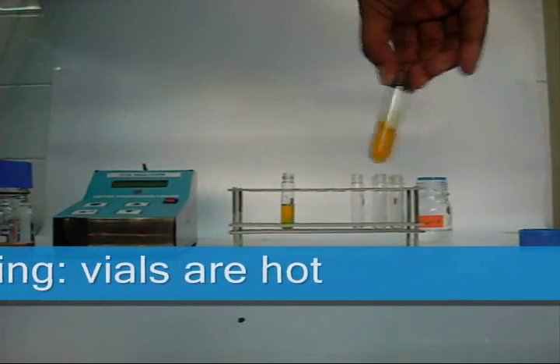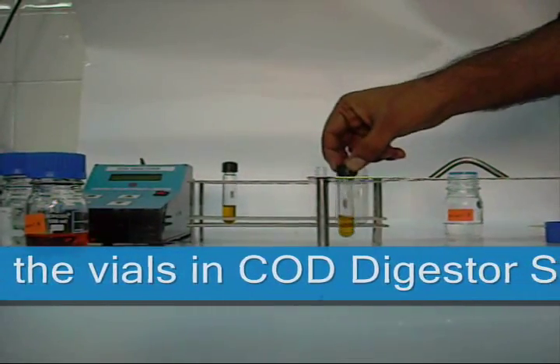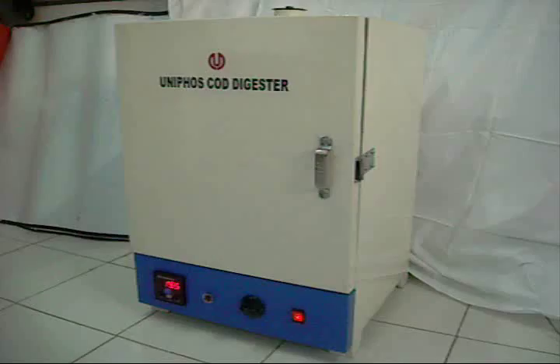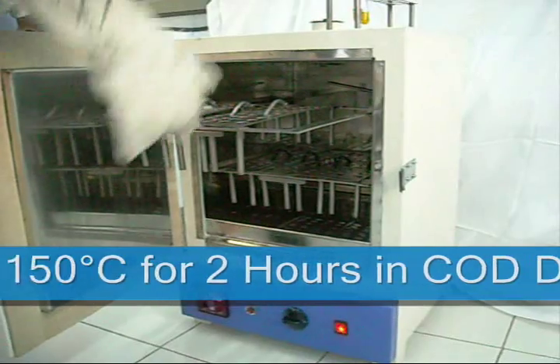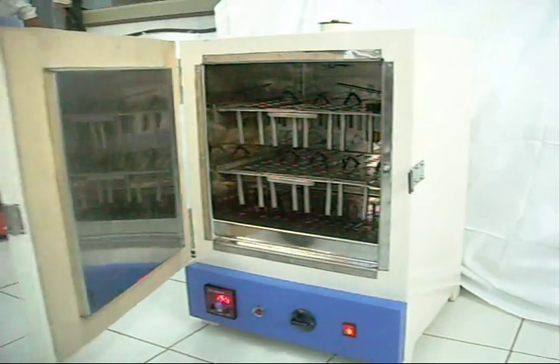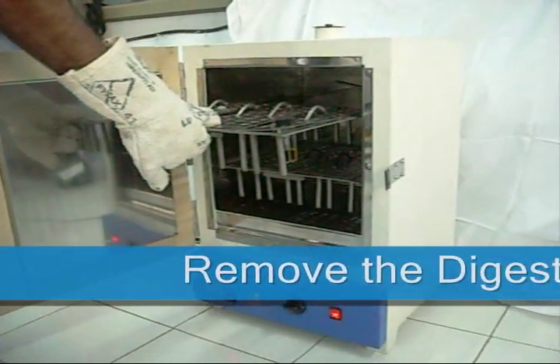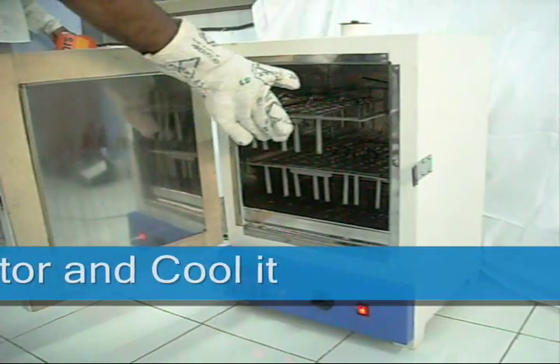Warning: vials are hot. Keep the vials in the COD digester's tank for two hours. After digestion, remove the vials from the digester's tank and allow them to cool.